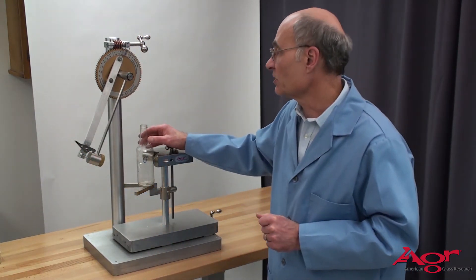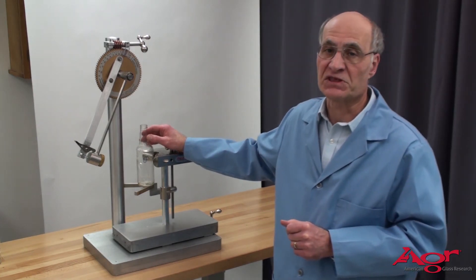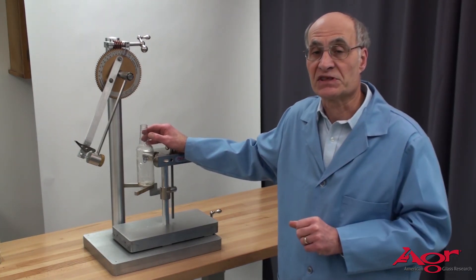Now, this sample broke at a much lower impact level of 30 inches per second. It still demonstrates the same mode of failure.